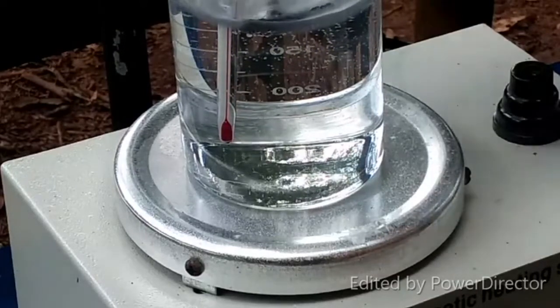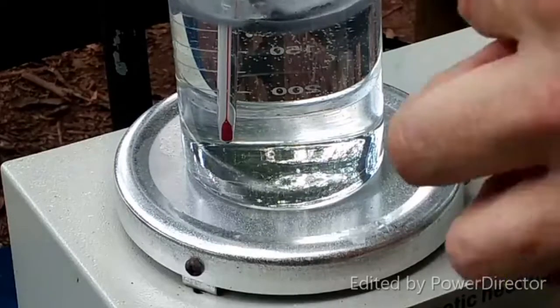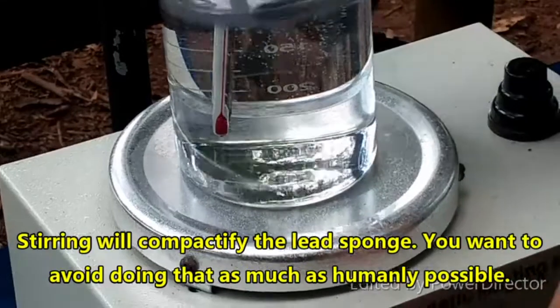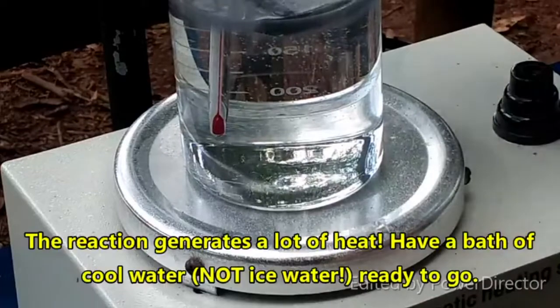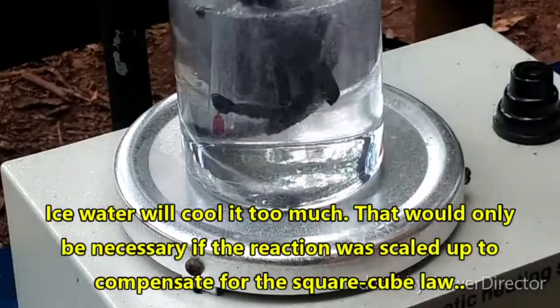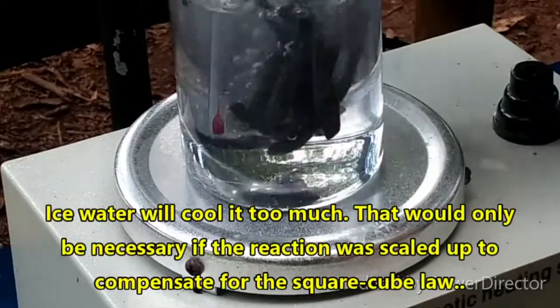I want to break this up a little bit so it isn't overlapping with itself as much as possible. We are going to have to use a glass stirring rod to hold this underneath the solution. We need to be careful about the temperature and maintain it between 40 and 50 degrees C. The textbook says to do this until all of the bubbling stops and there is no more gas evolved, which will take about 30 minutes according to them.